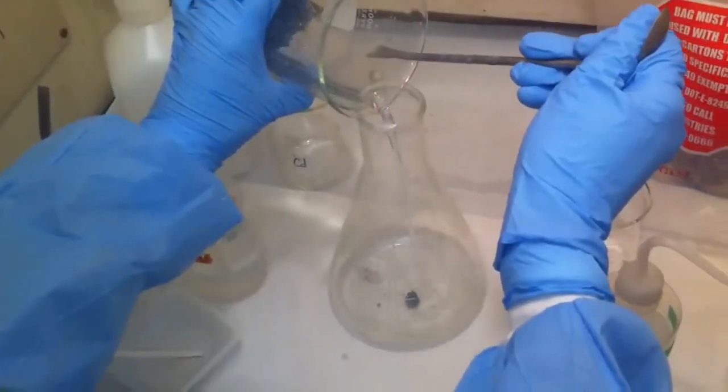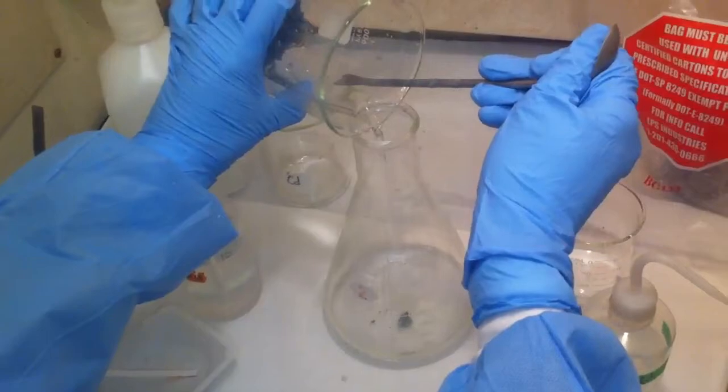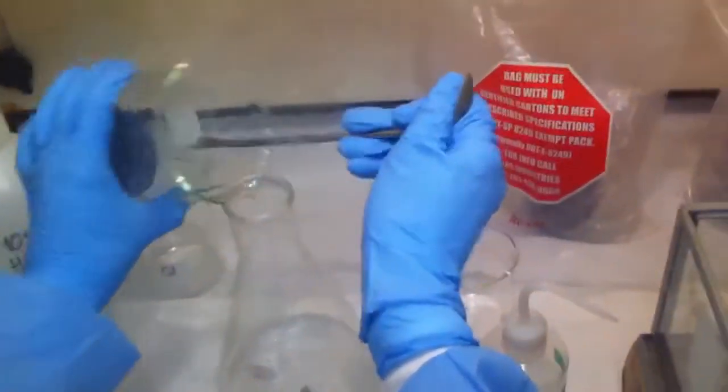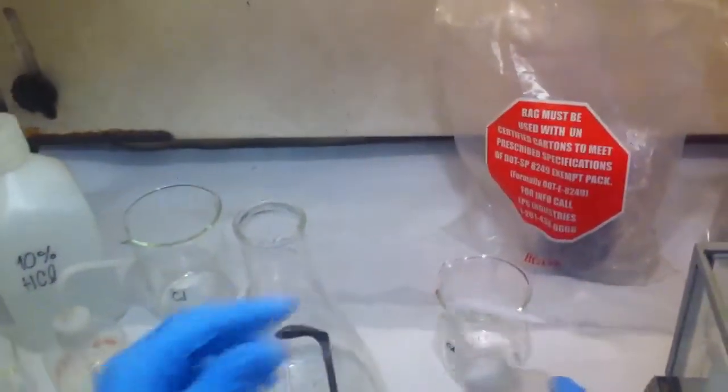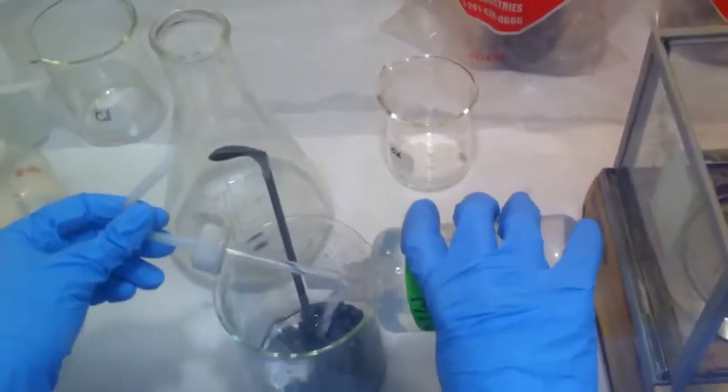So now I'm decanting the acid water, pouring in some fresh DI.